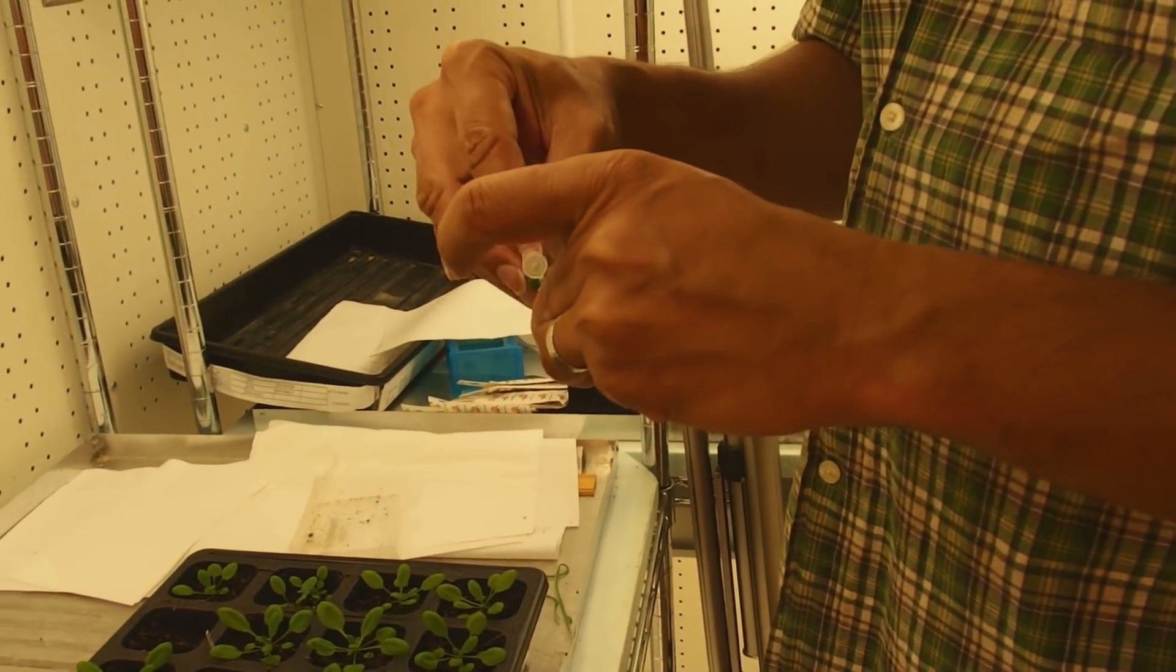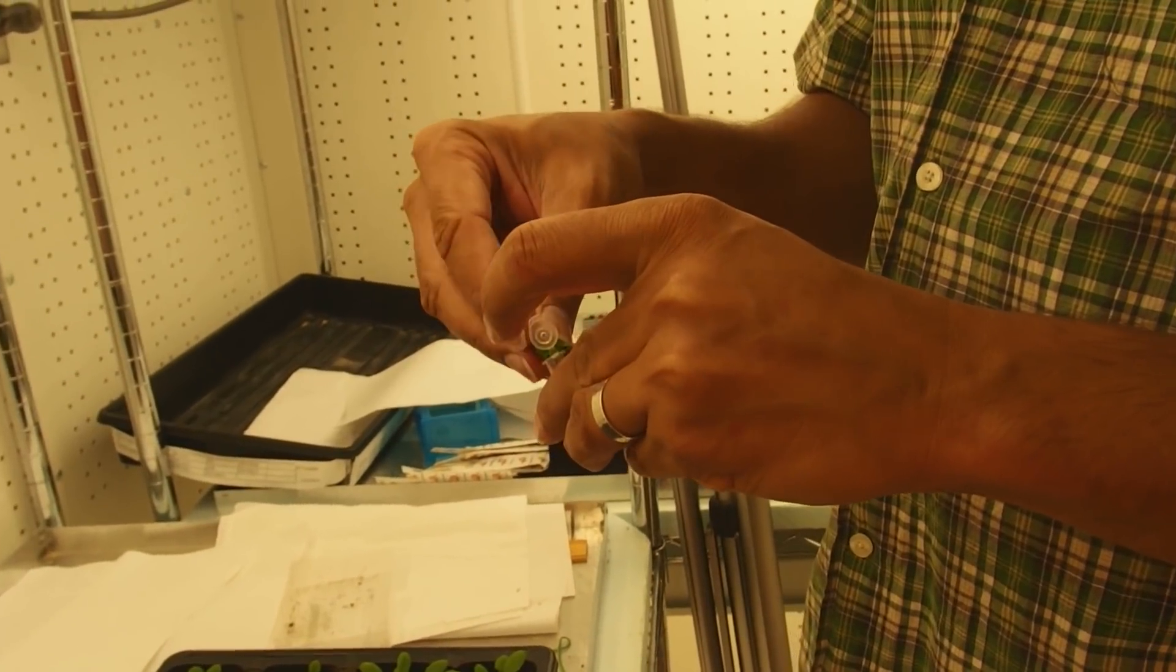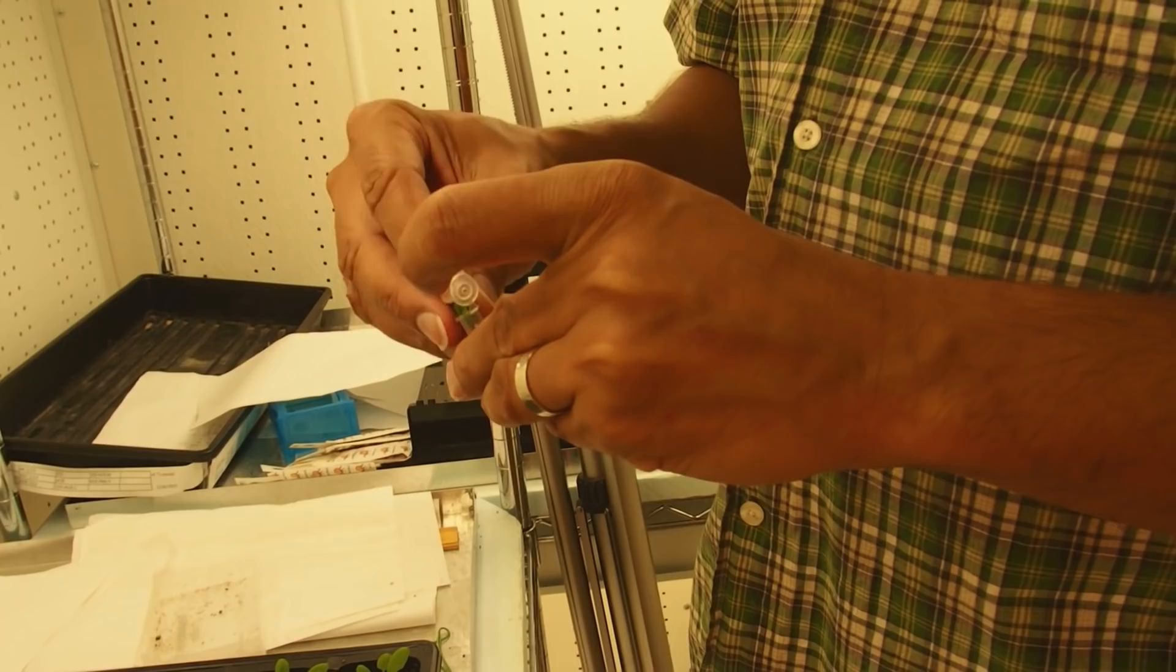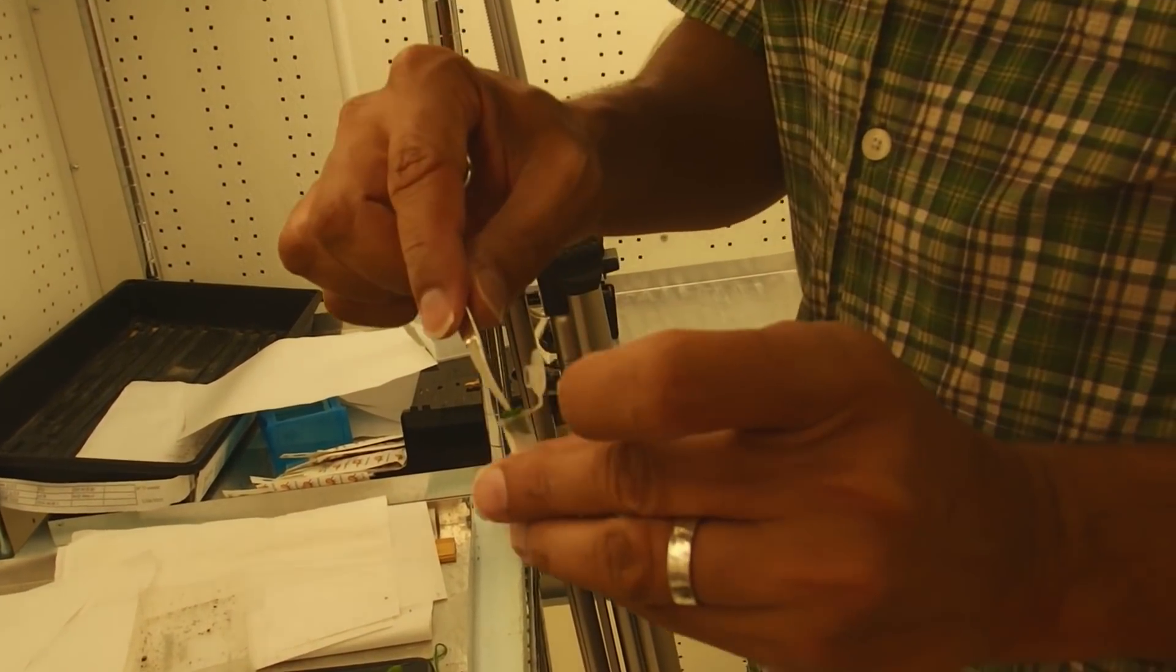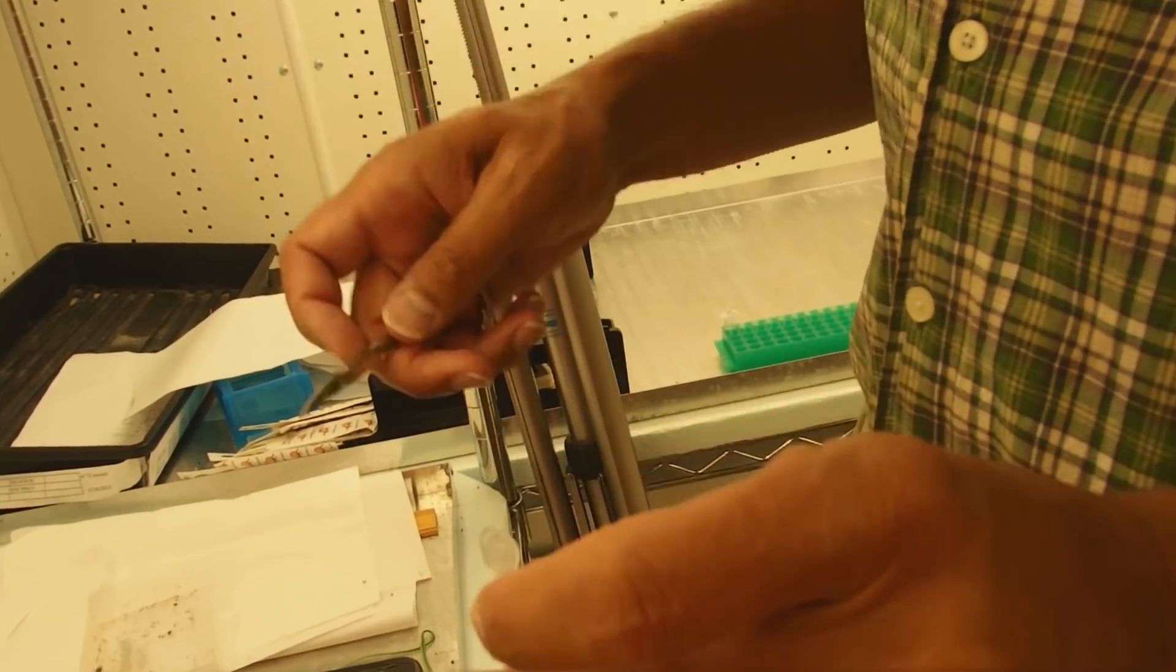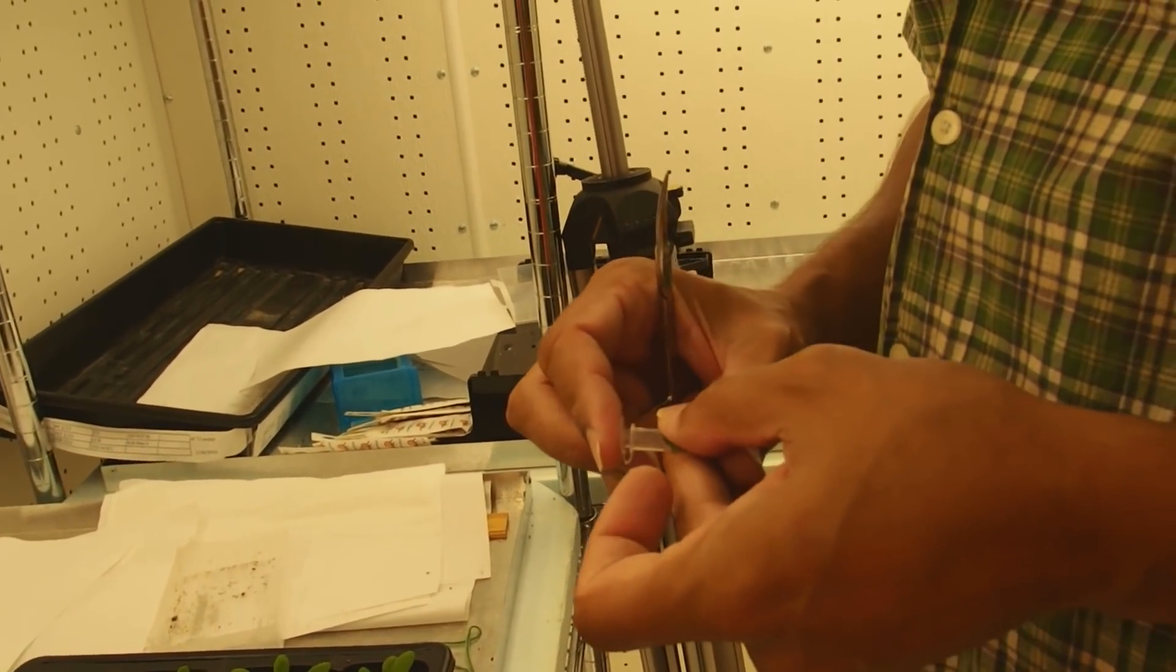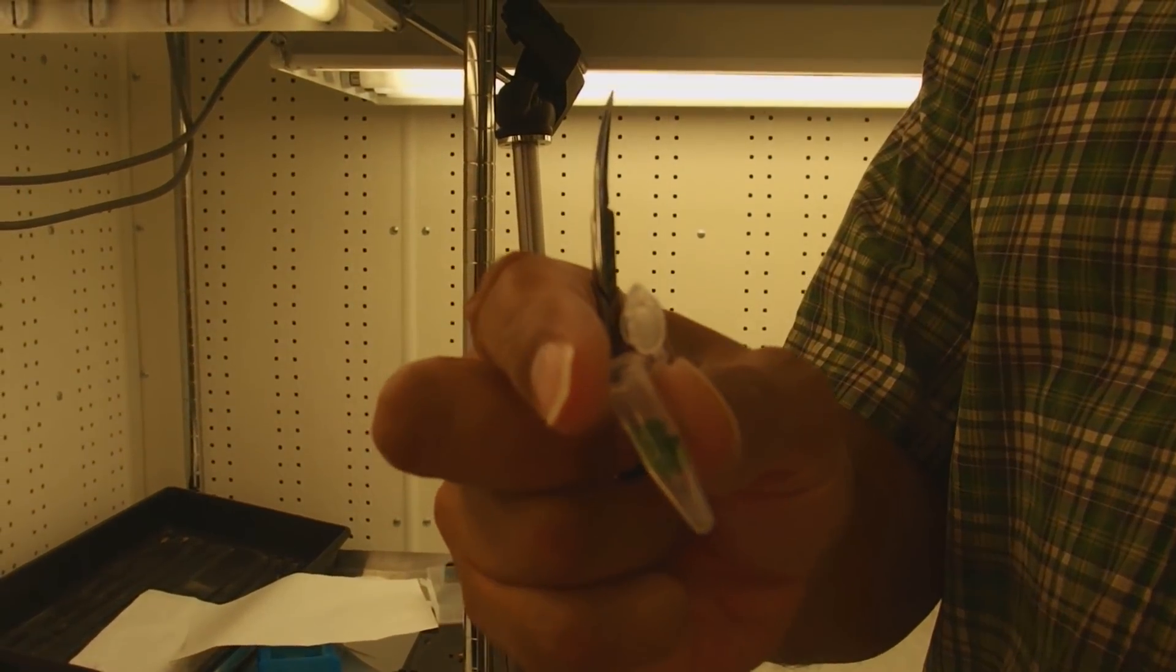Stick this into this little tube here. Use our scissors to push it in a little bit. We'll bring that up to the lab to extract DNA from it.